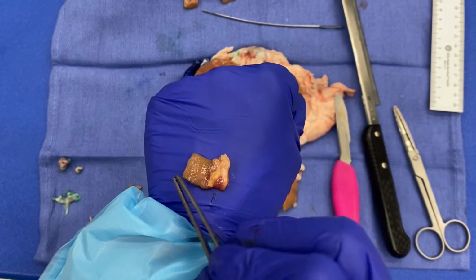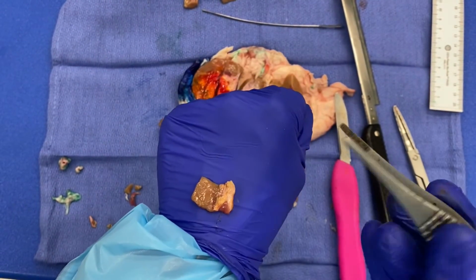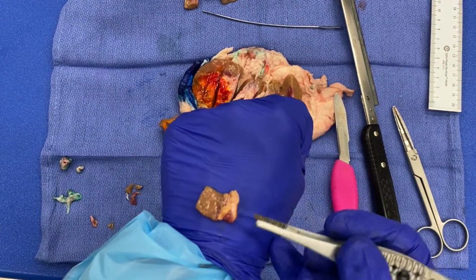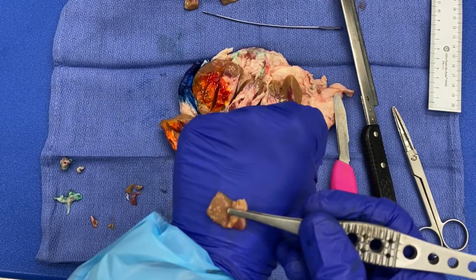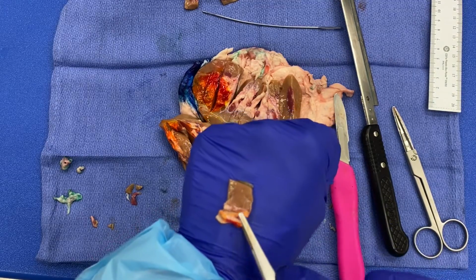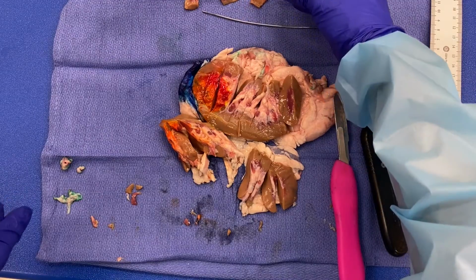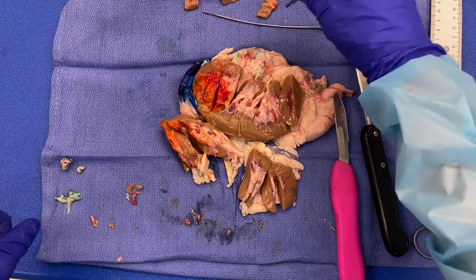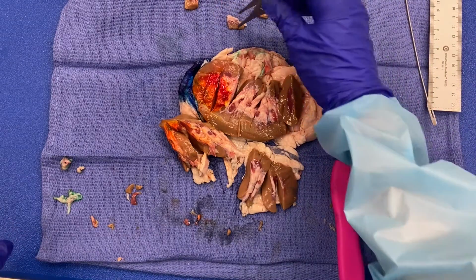I'm not putting in a tiny strip of tissue. I have a nice square of tissue that will fill the cassette. It will give the pathologist abundant information to look at under the microscope, and will give them a great image. So remember, we don't want to put in just tiny little strips of tissue. We want the pathologist to see a nice amount of information, give them relationships and structures.